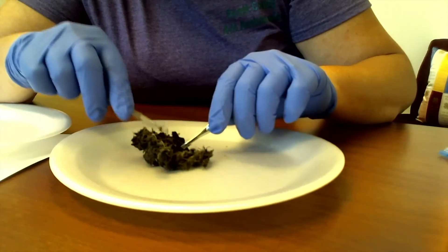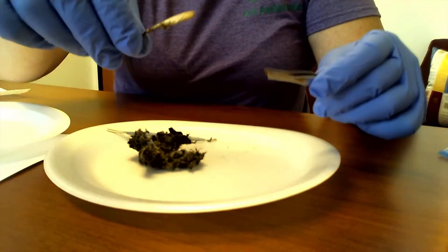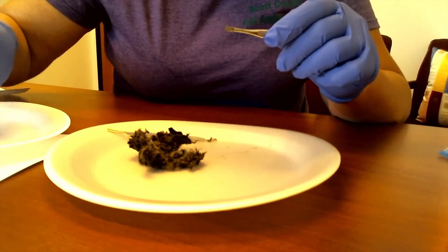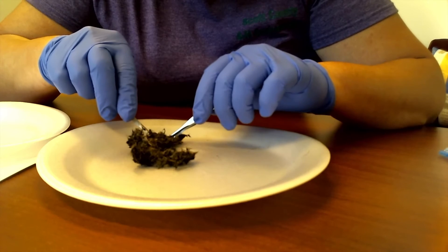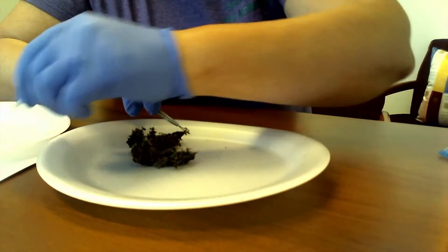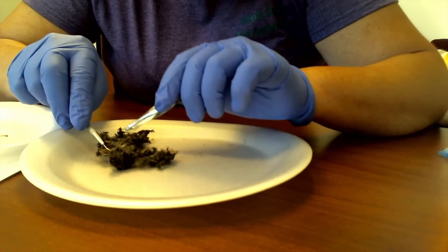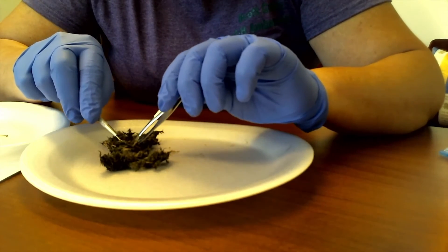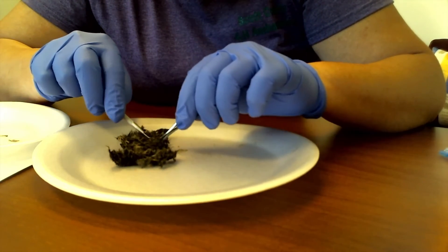But what about that feather? I told you we had a songbird feather here. If we pull that out, I can show you the feather. So we've been eating songbirds as well as a vole. There's some connective tissue in here, tendons. We have tiny little rib bones that haven't been digested as well. There's an extra jaw bone here, so this owl has actually eaten two voles and regurgitated them in its owl pellet.